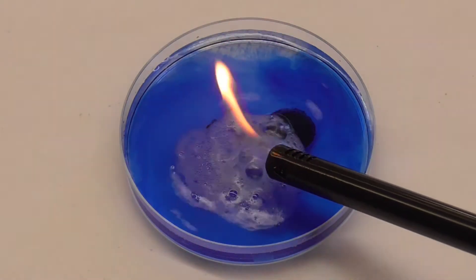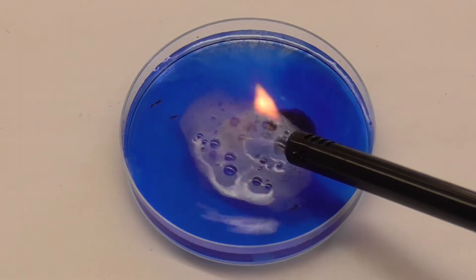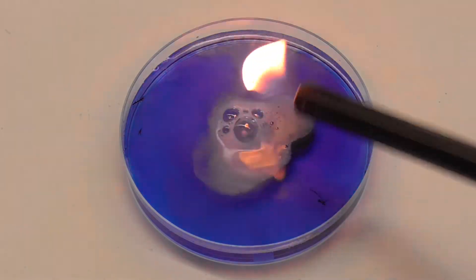I think I may see a bit of a pink color, but I'm not really sure. Let's try these experiments in a darker room. Did you see that? If you blinked, you probably missed it.